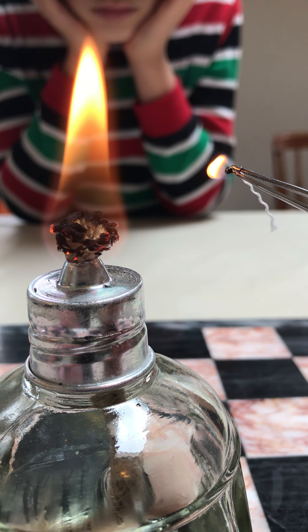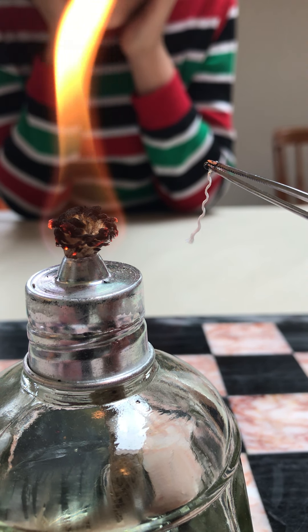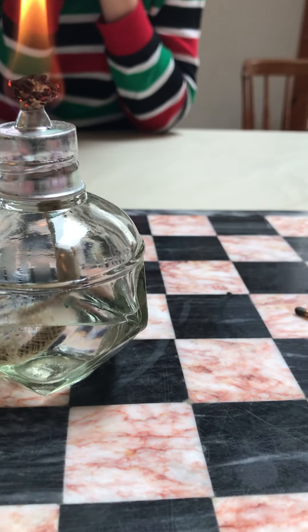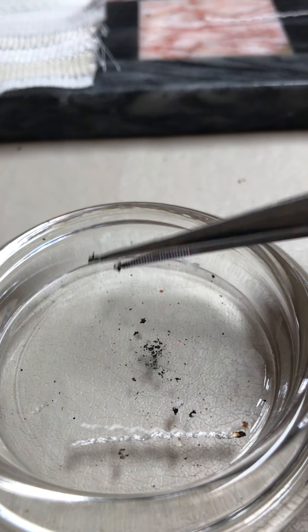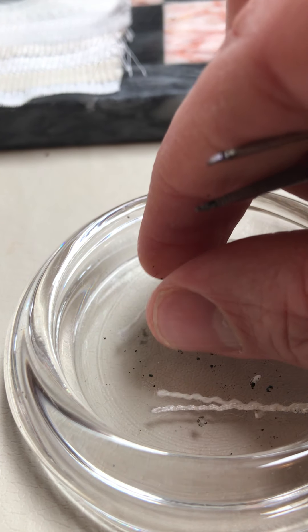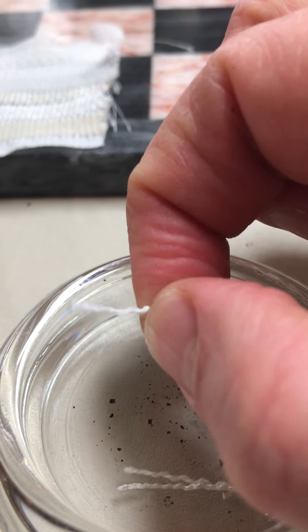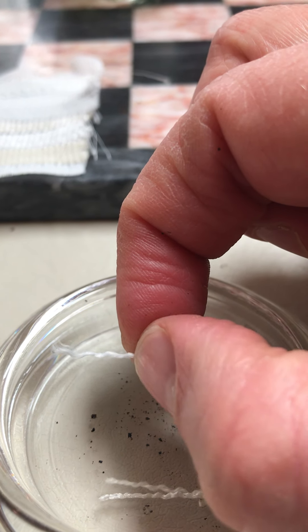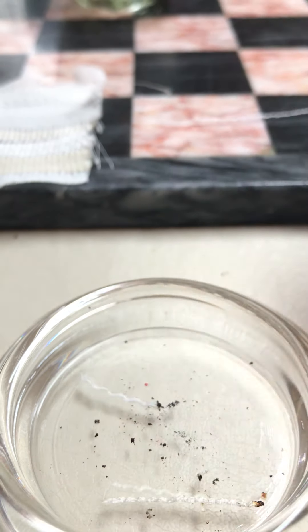Now we're going to plunge the fiber directly into the flame. You notice it ignites and burns back along the length of the fiber - so we write down 'ignites and burns back along the length of the fiber.' Finally, we look at the residue in our watch glass. If you feel it and roll it between your fingers, it turns into a black plastic-type substance. So the residue is like a black plastic - you can see it balled up. That was acetate.